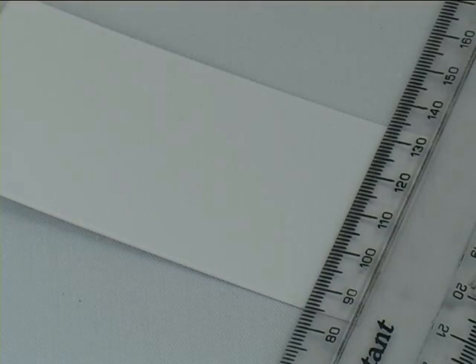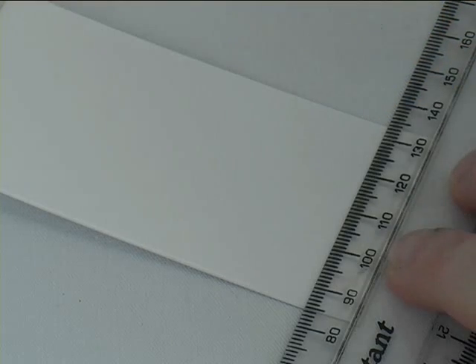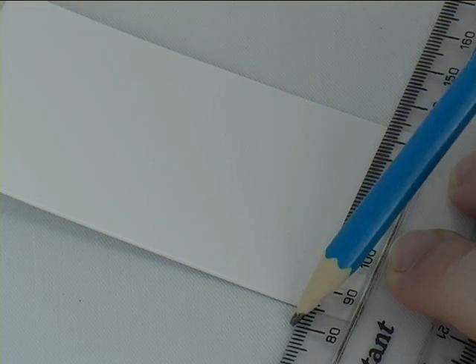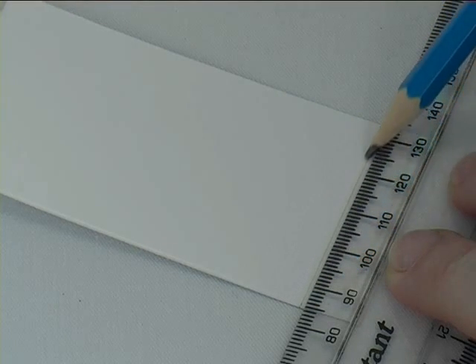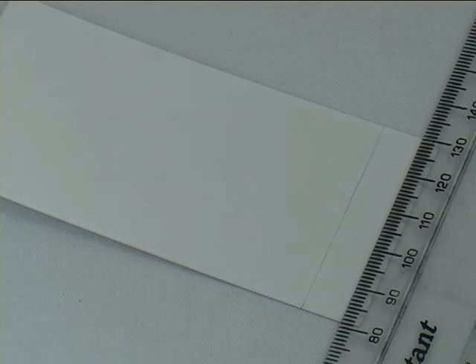Here you can see a TLC plate and a ruler, which I use to hold the TLC plate, and a soft pencil, which I use to draw carefully a line. As you can see, I go to great lengths not to touch the TLC plate, because that would show up later on as a fingerprint.